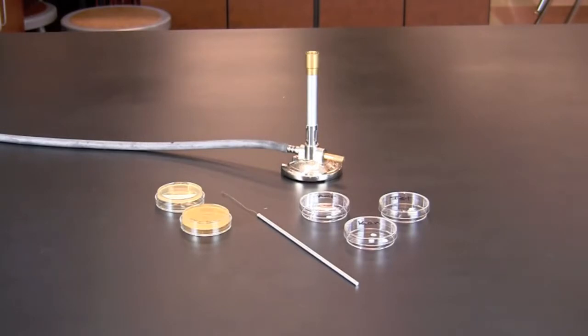In this video you will learn how to perform a modified Kirby Bauer or disc diffusion test. The test was developed as a standardized method to test the susceptibility of bacteria to antibiotics.